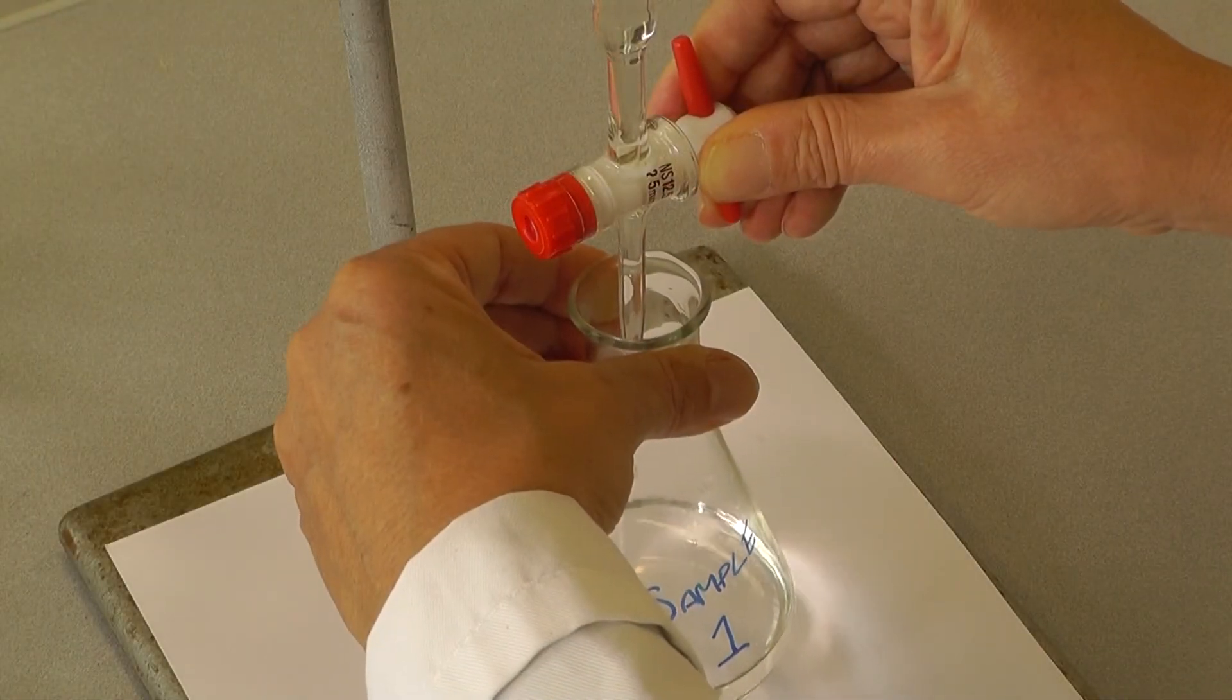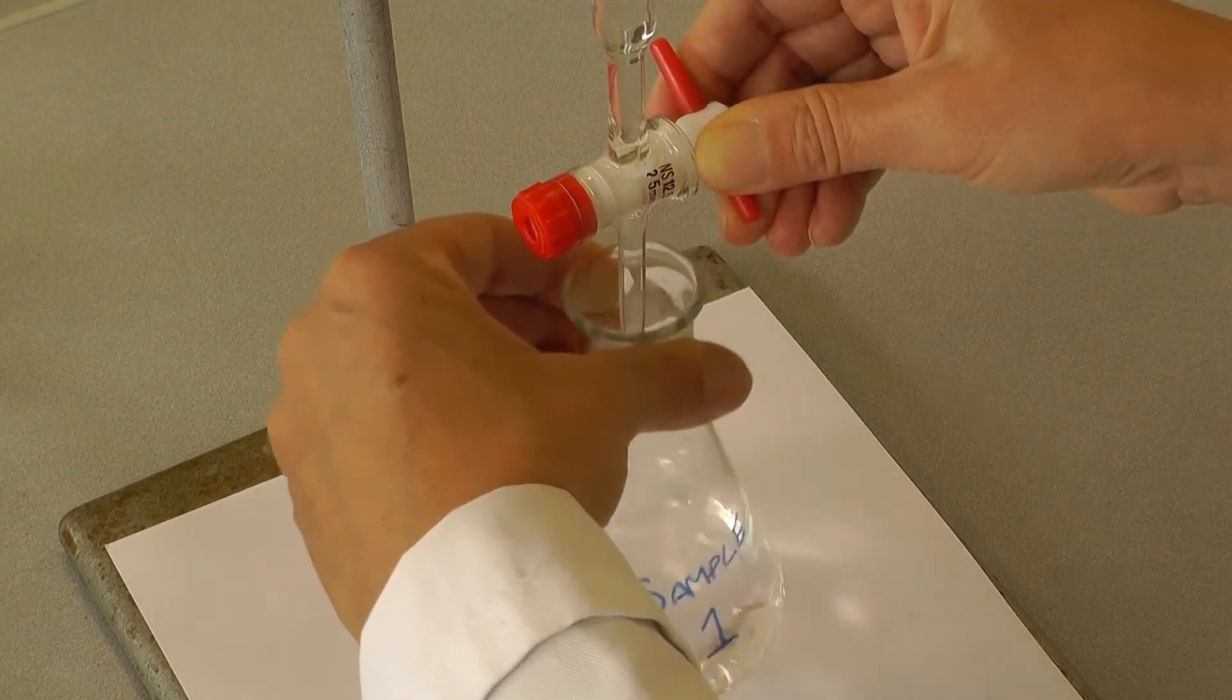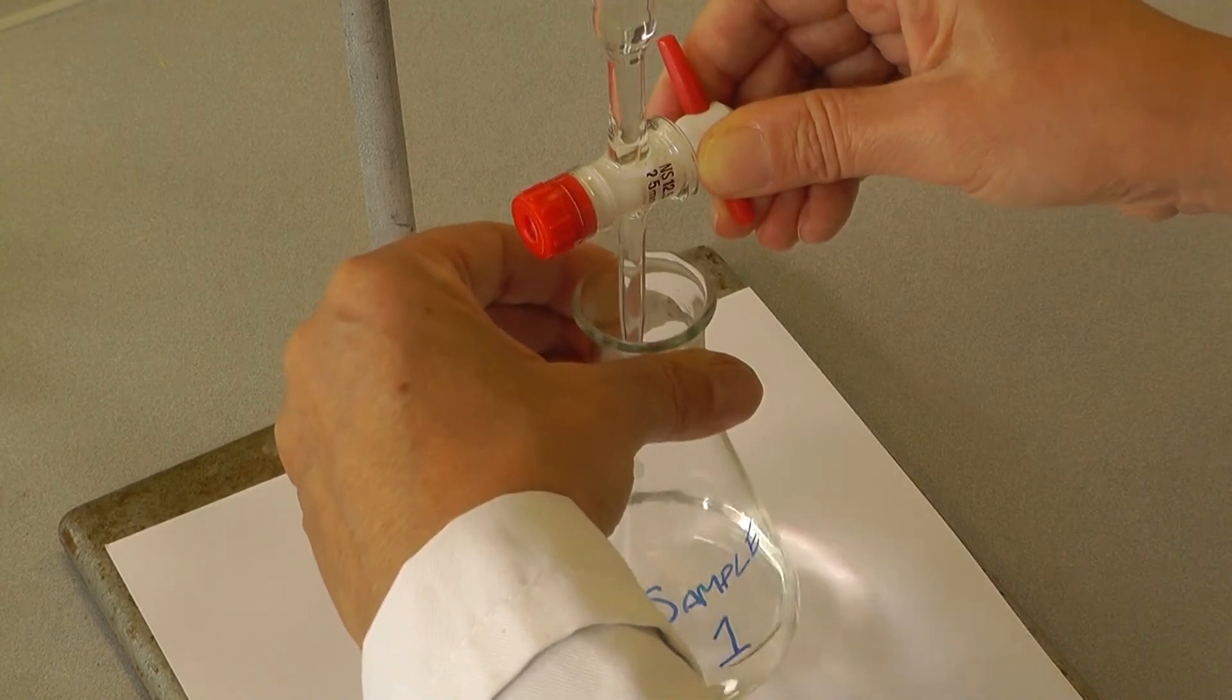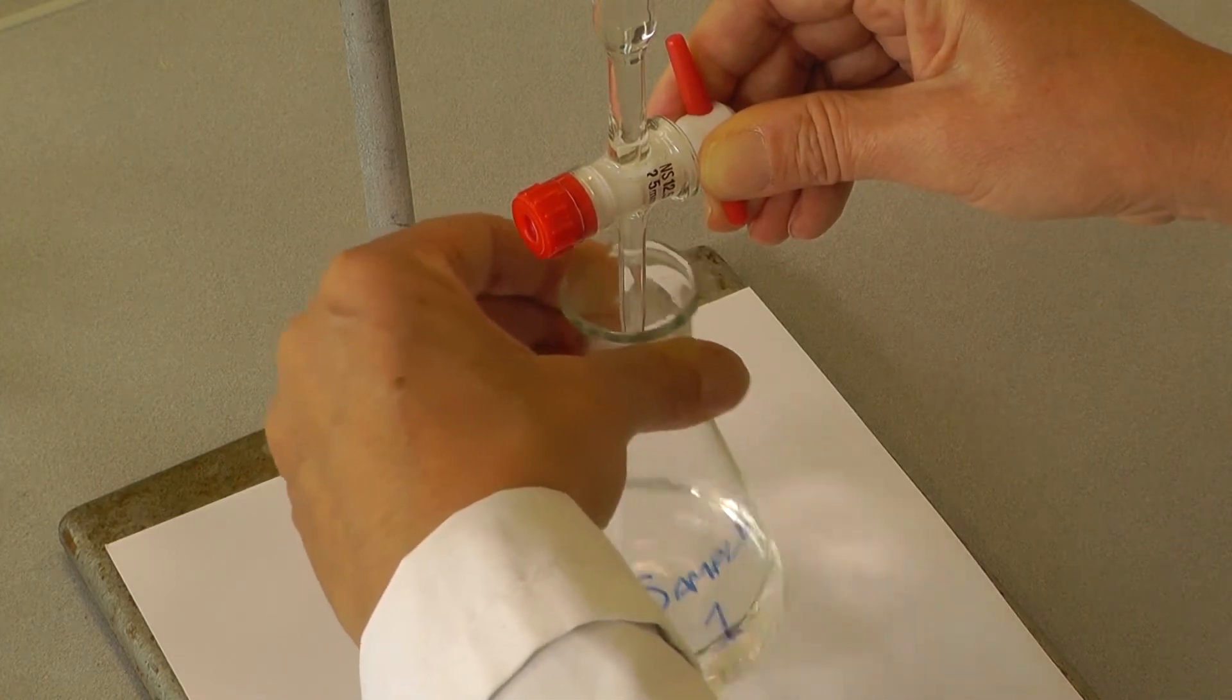At this point, add the solution drop by drop. It is important not to rush when approaching the end point of the reaction. It is very easy to overshoot the end point and get the wrong result, so take your time.